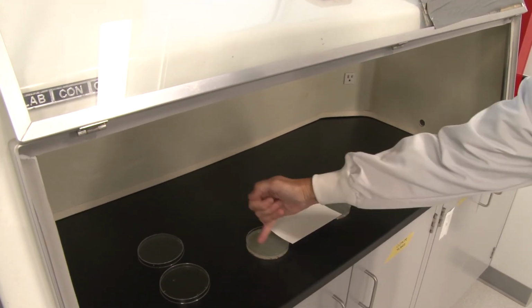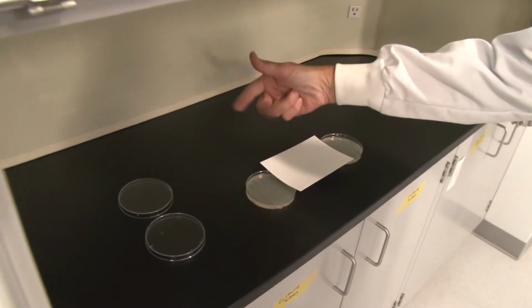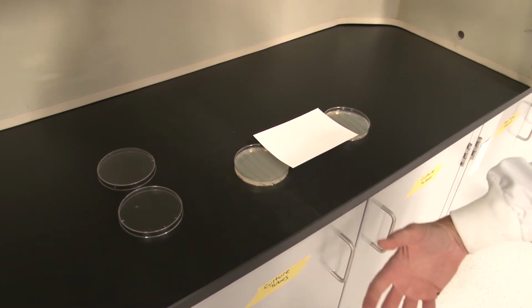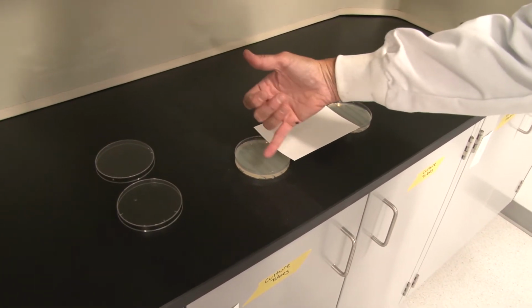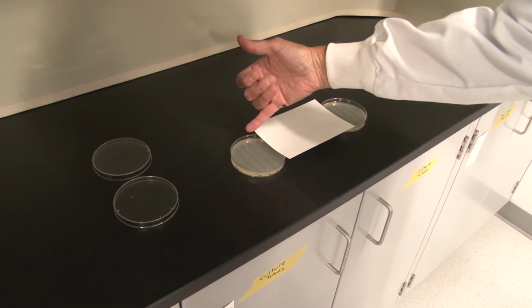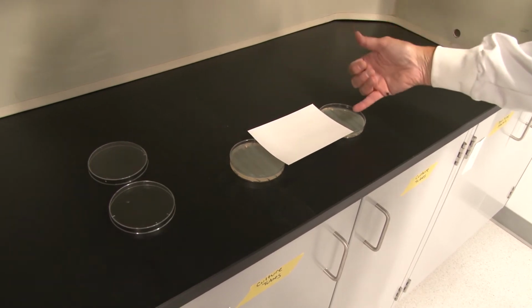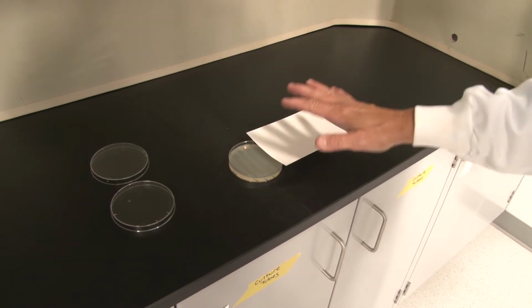At this point, this region, the 60 seconds, has been exposed for a total of 30 seconds, 10 seconds, and 10 seconds. That's 50 seconds. It needs one more 10-second exposure to be a total of 60 seconds or 1 minute. The 30-second realm so far has only been exposed for 20 seconds, and the 20-second has been exposed only for 10 seconds. So right now, what I've got here is the 10-second strip is opened up and ready to be exposed for 10 seconds. When I'm done here, the plates will be finished.